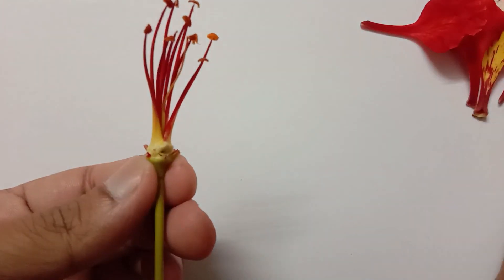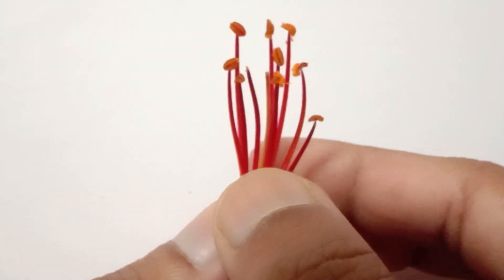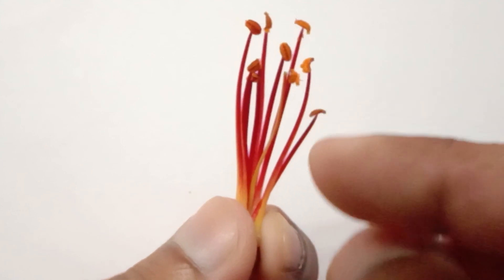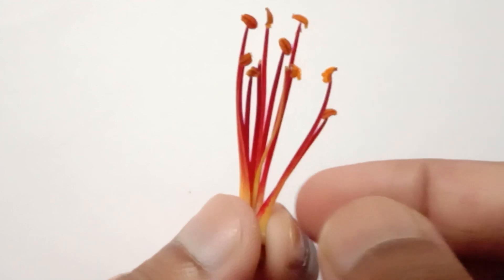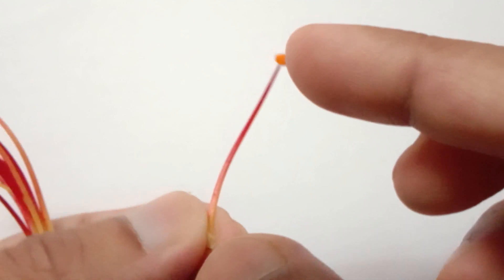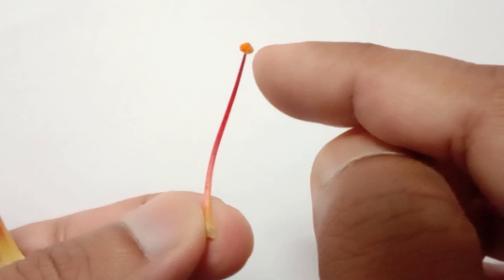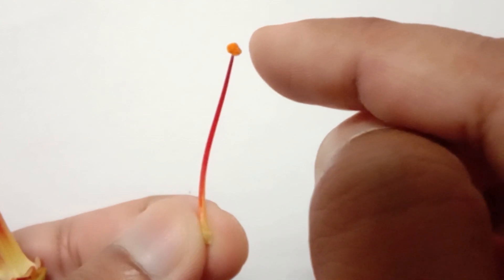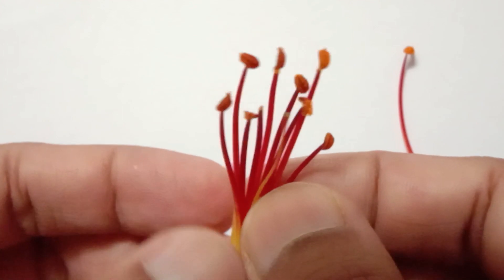The most important parts to understand are the male and female reproductive parts of this flower. These stick-like structures with their heads are the male parts. This single male part is referred to as stamen. The head of the stamen is referred to as anther, and the remaining tube-like structure is referred to as filament. This anther contains pollen grains in it.